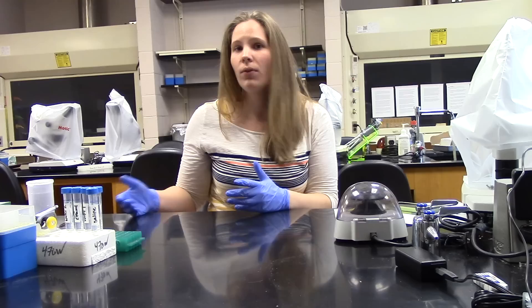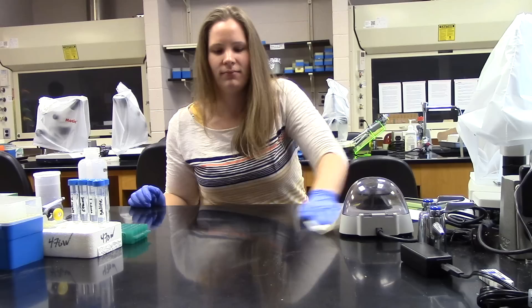In this video we are going to demonstrate the extraction of the microbiome from our bean beetles. First and foremost, we must make sure we have a sterile environment throughout the entire procedure. To do that, we sterilize our work surface and make sure that we are wearing gloves.